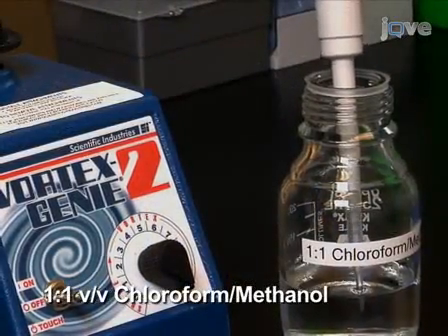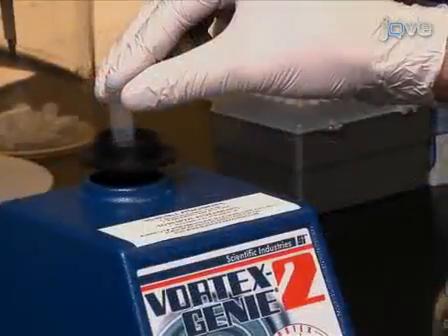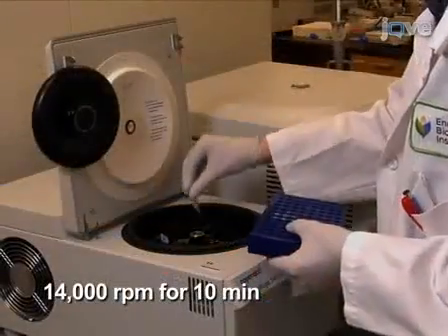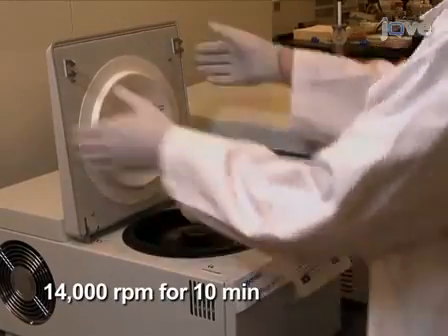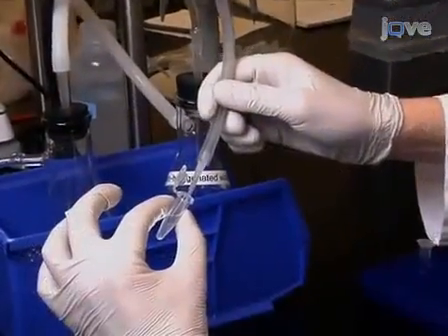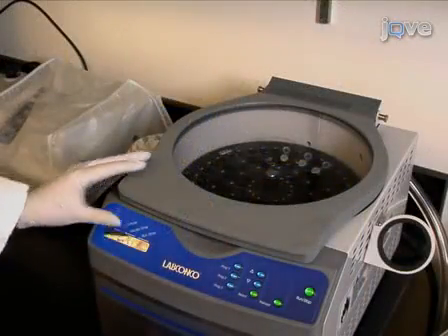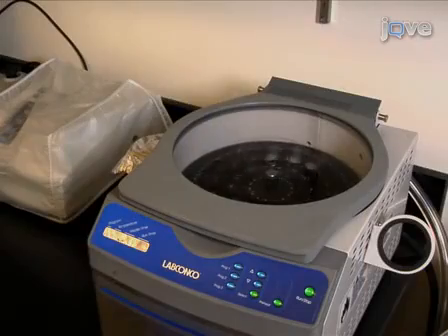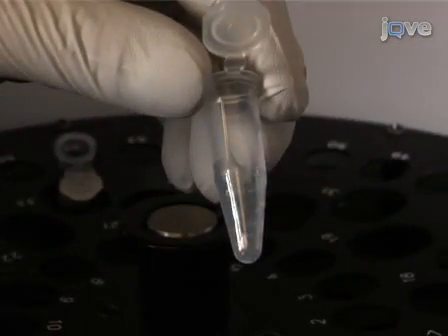Add 1 milliliter of chloroform methanol solution to the pellet remaining in the tube, vortex thoroughly to resuspend the pellet, and centrifuge. The chloroform methanol extracts hydrophobic compounds such as lipids. After centrifugation, remove the supernatant and dry the pellet completely using a vacuum centrifuge. This completes the isolation of the cell wall material, which can now be treated to yield specific oligomers.